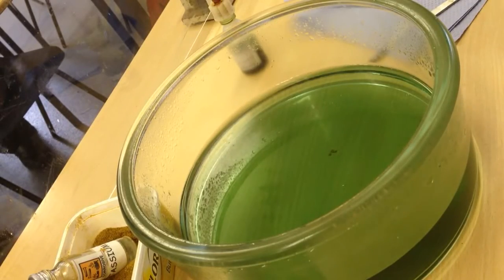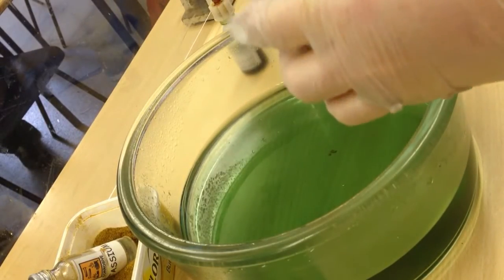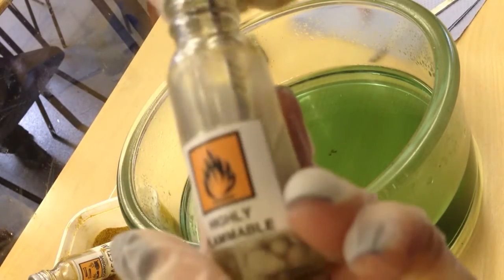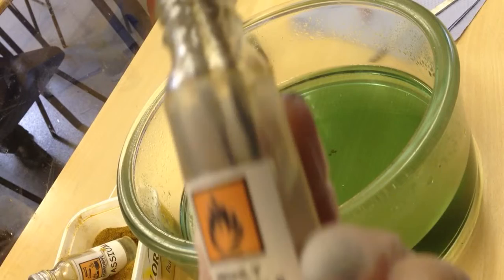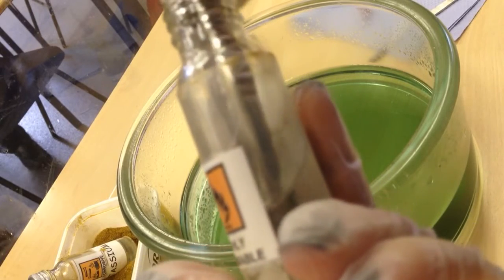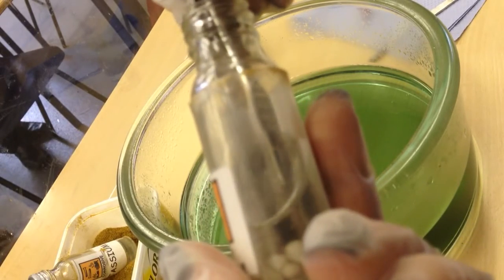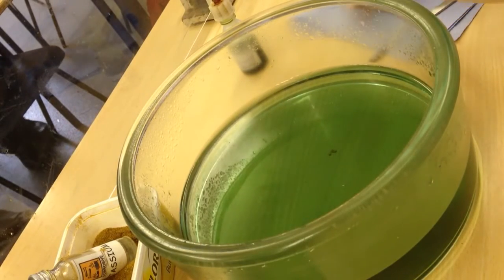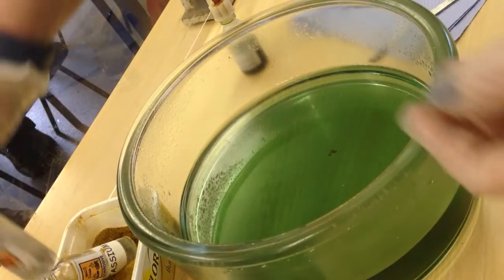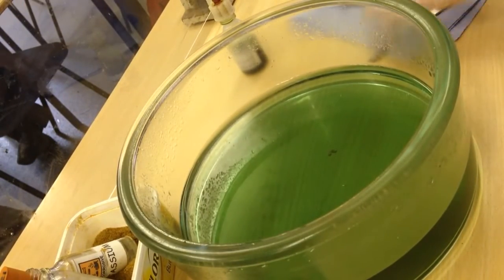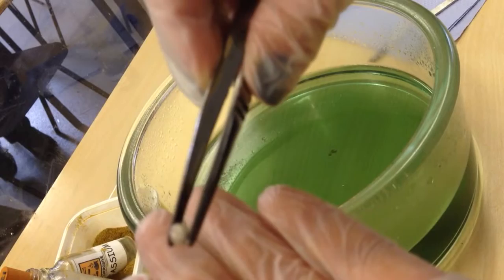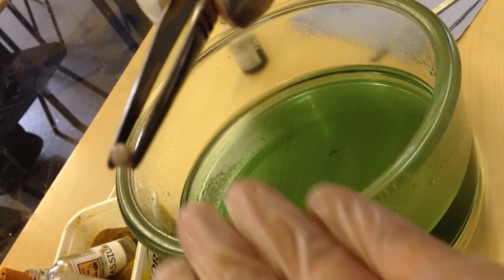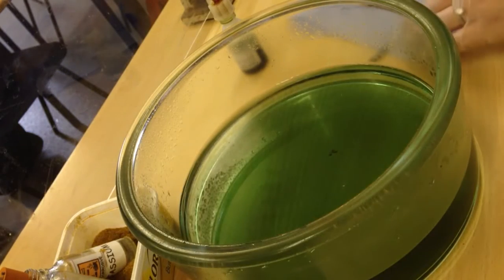So what I'm going to do is just take out a lump of sodium. See if I can get a nice big lump out. Okay, so I've got my lump of sodium over here and we can see that it is not very silvery, so I'm just going to cut it in half.